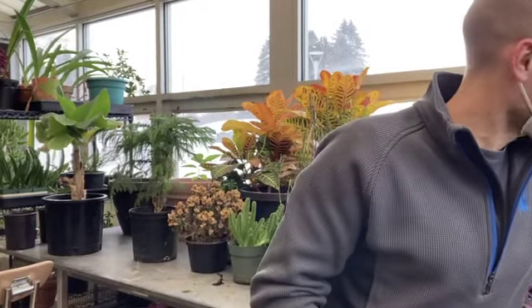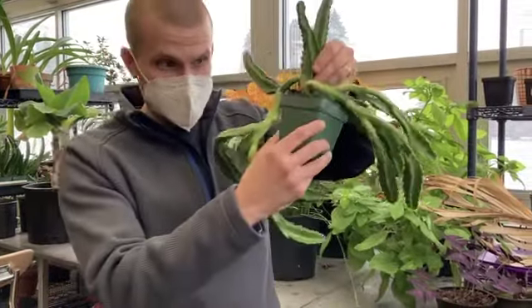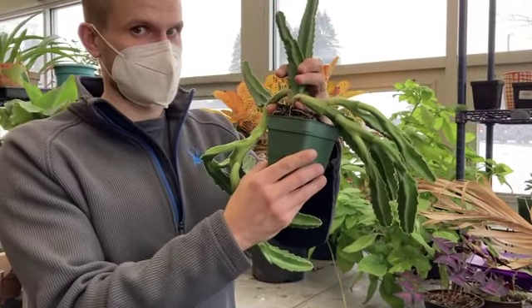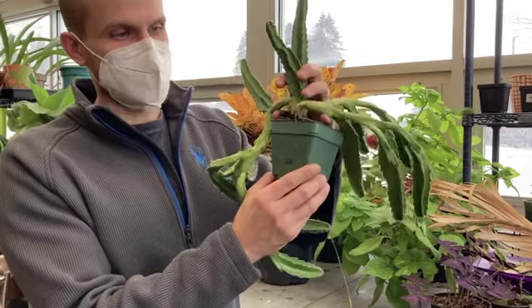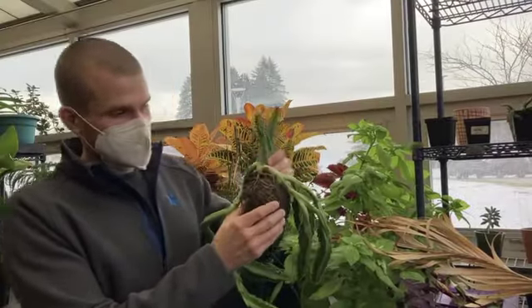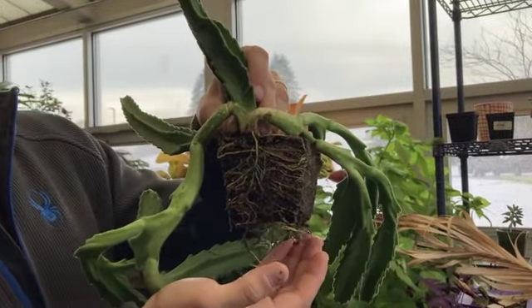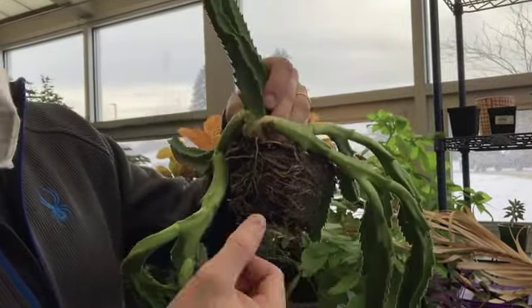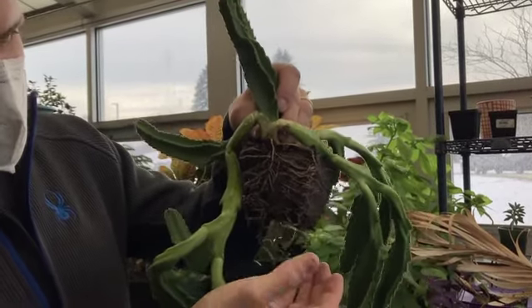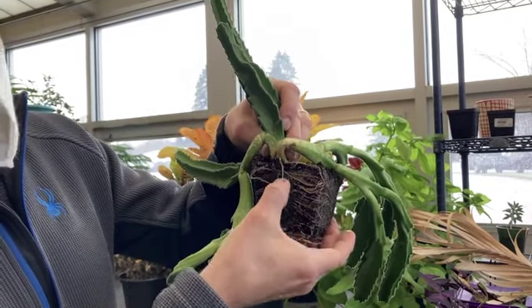Now, when we pull up a very, very root bound plant, this plant will not have as deep of an architecture as it should, but it will still have the pattern that we want to see. All right, so here we have our Stapelia, a eudicot from Africa. Now you'll notice that it has kind of this fibrous root system in lateral roots because it's somewhat root bound, but you do see a much more distinct main root coming from it.